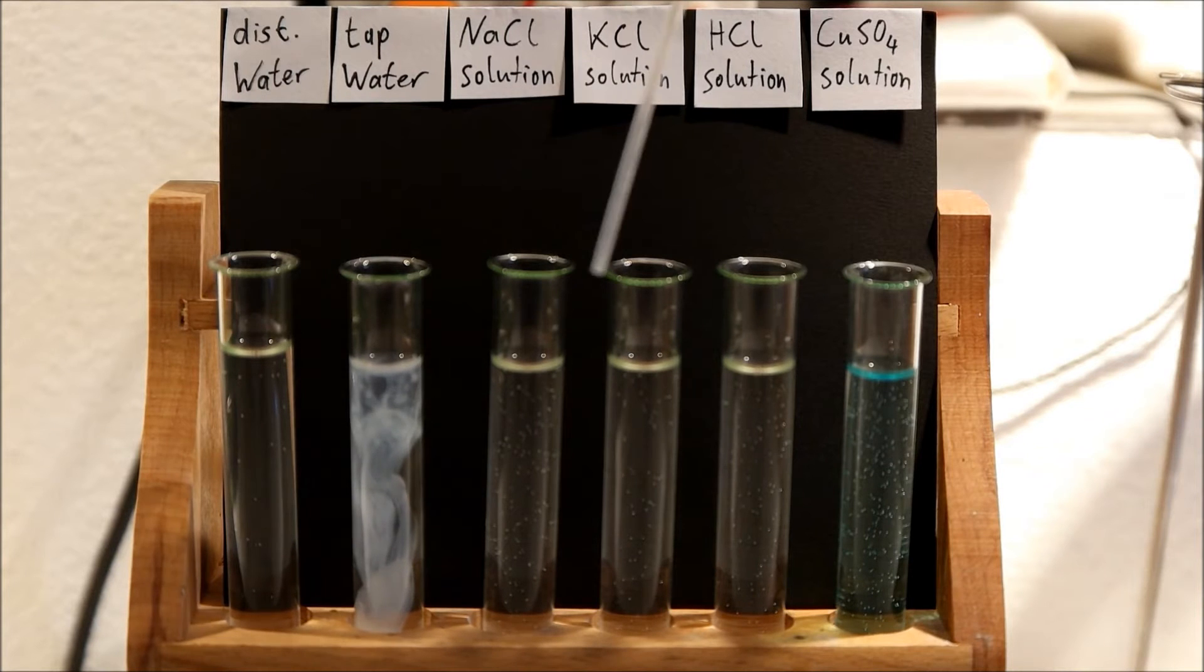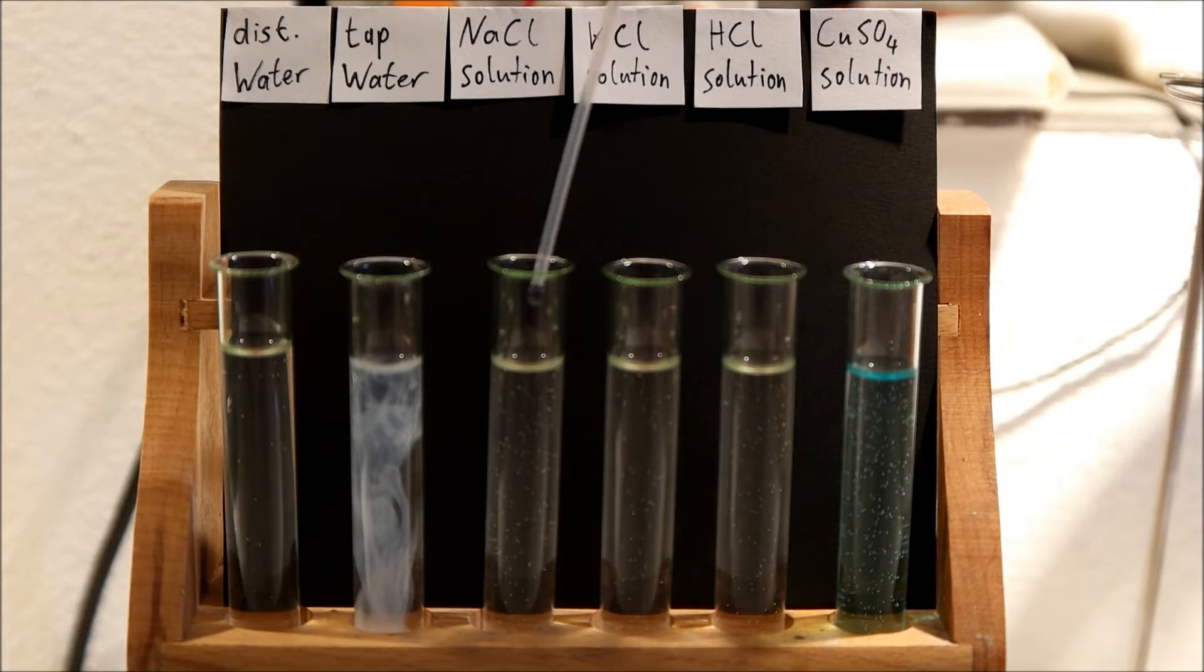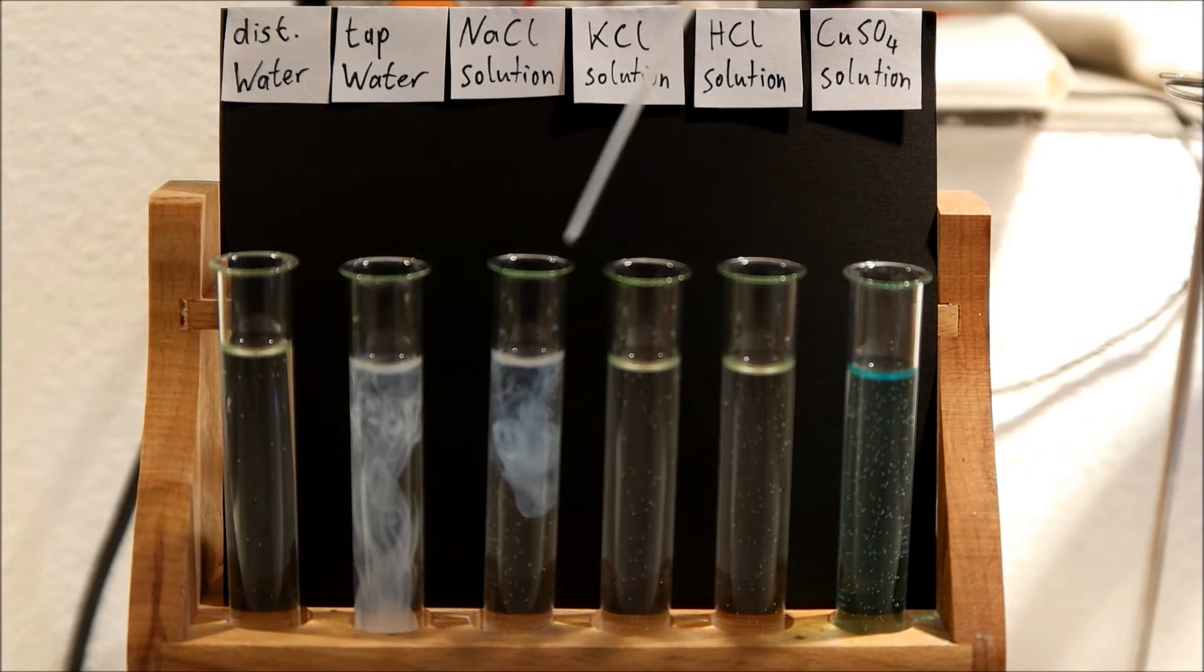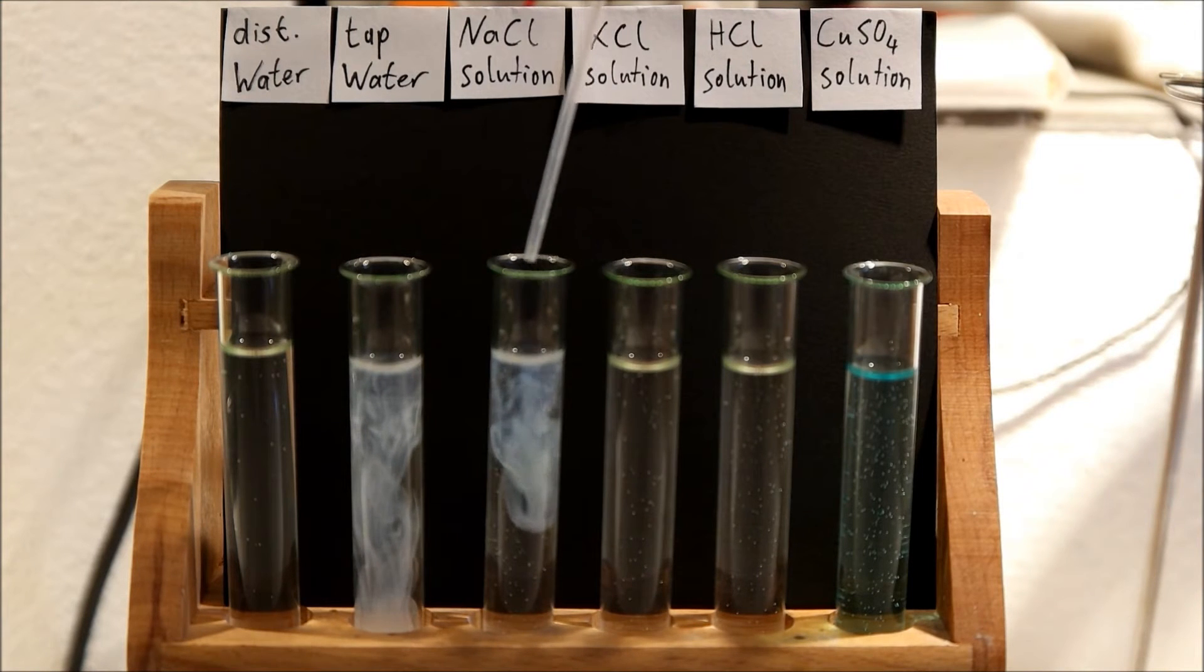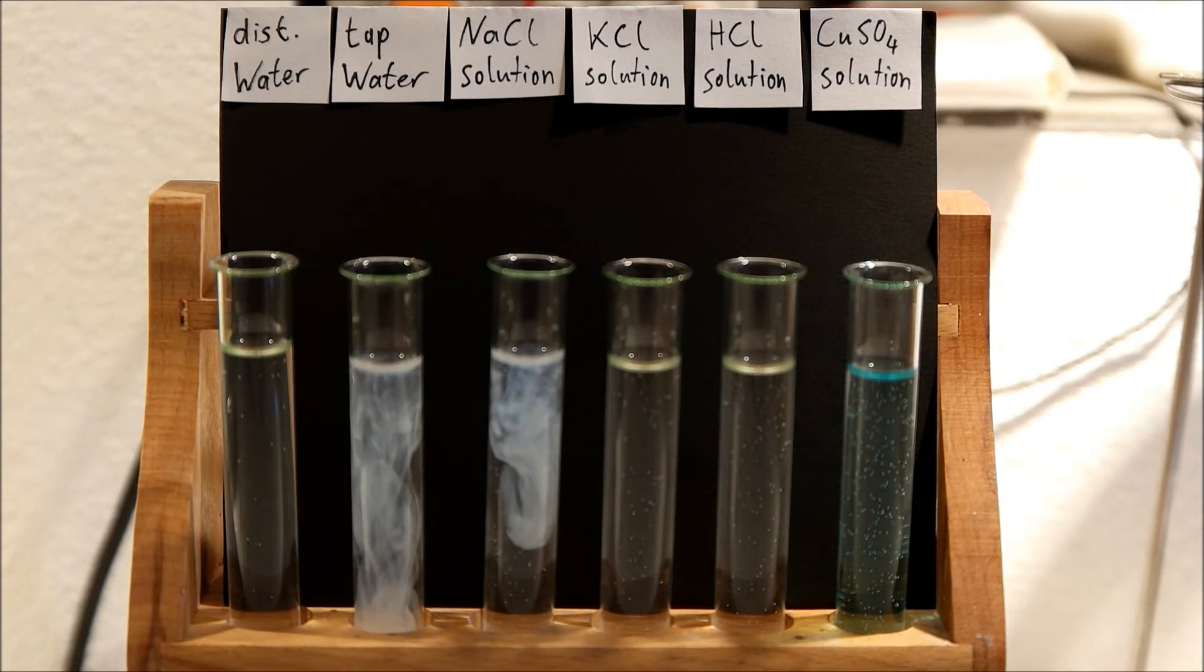The same happens with the sodium chloride solution, but even stronger because I put around half a gram of the salt in it, and in the tap water there is less.